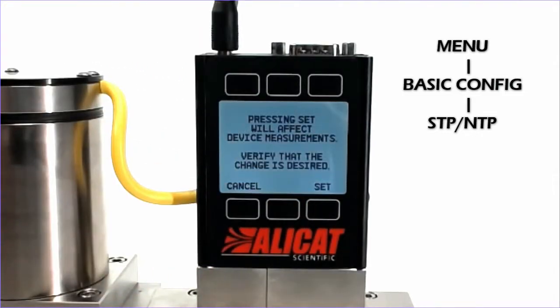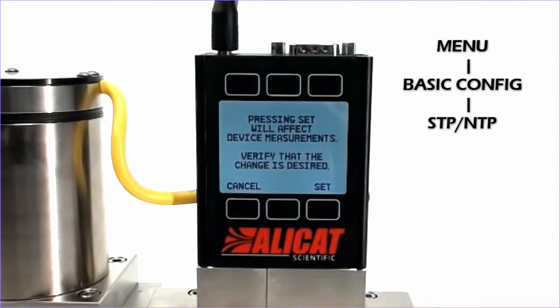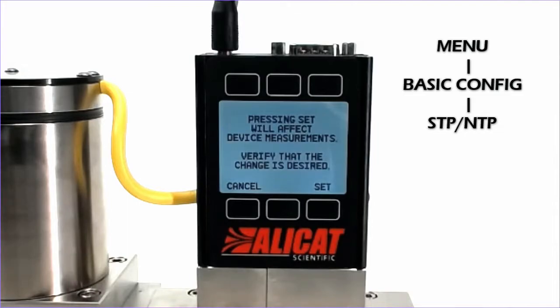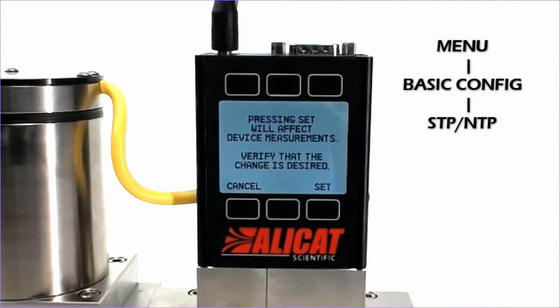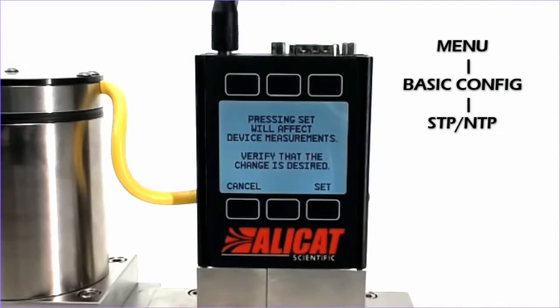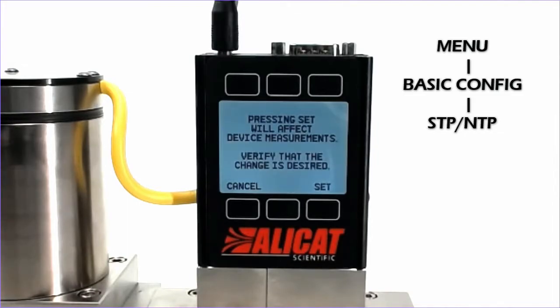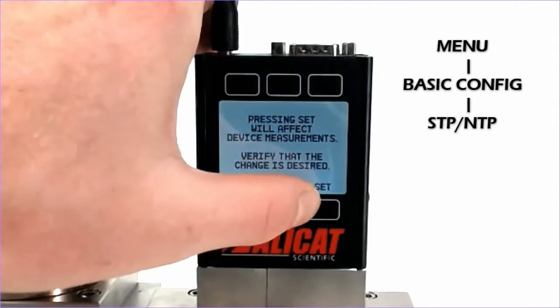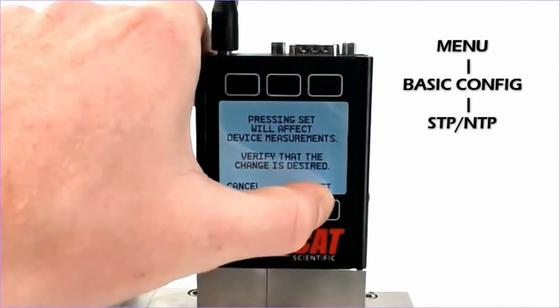It will give us a warning that pressing Set will affect the device measurements, as the STP is used to convert that volumetric flow into a standardized mass flow. We will hit Confirm.